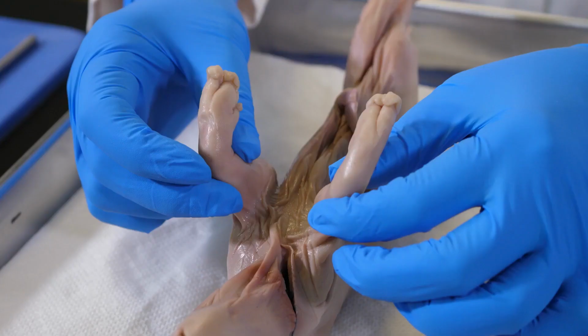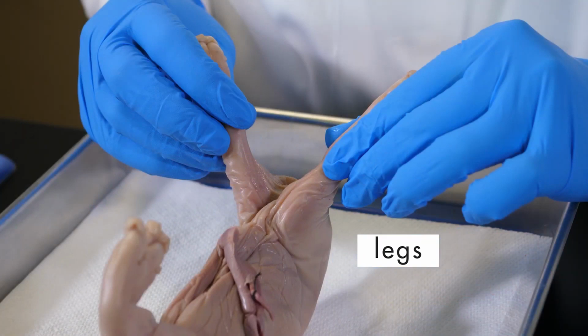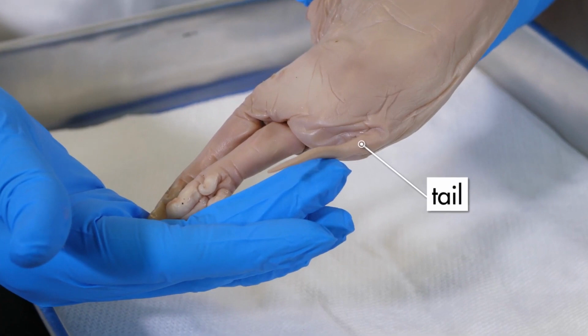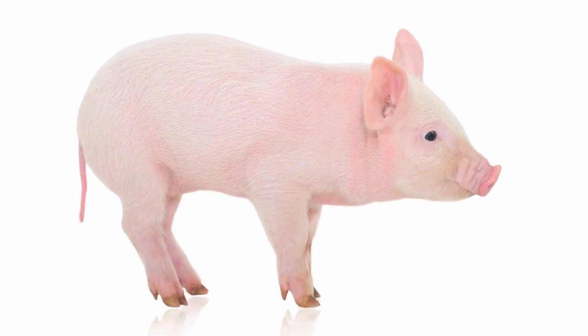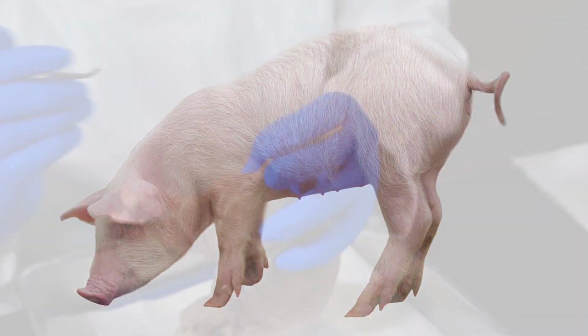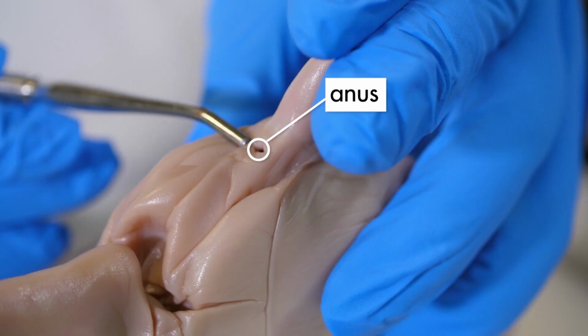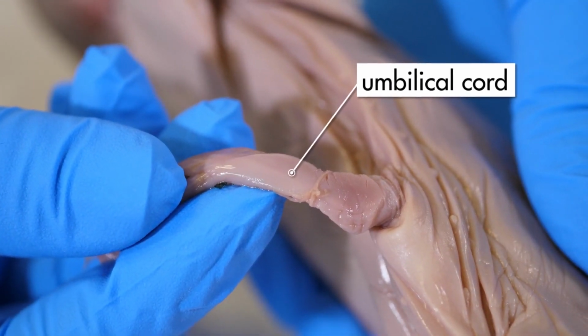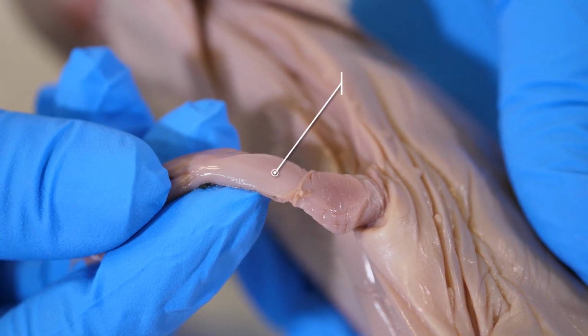Like most mammals, the pig has 4 legs. The 4 legs are about the same length because this mammal was created to walk on all 4 legs. At its posterior end is a short tail. Some pigs have straight tails. Others have curly tails. Just below the tail is the anus. On the ventral surface is its umbilical cord, which attaches the fetal pig to its mother's uterus.